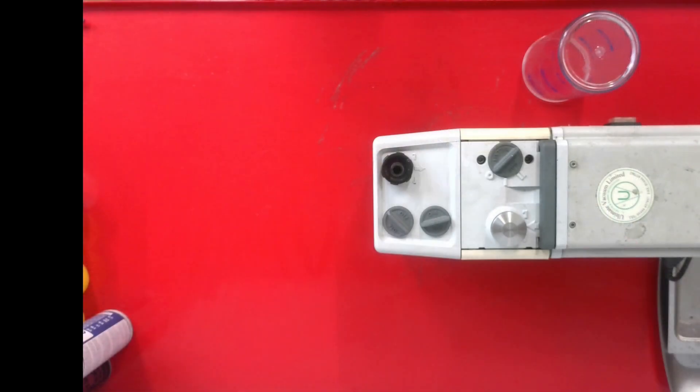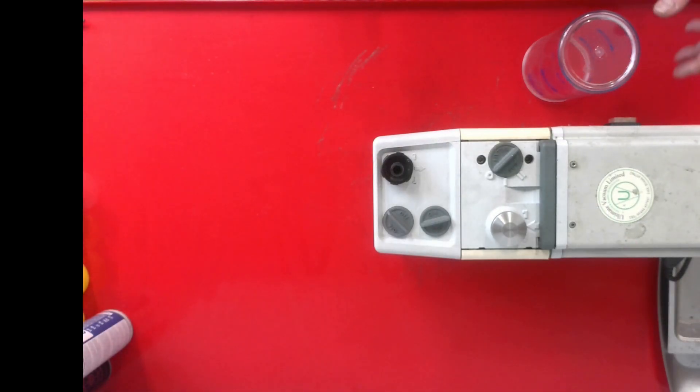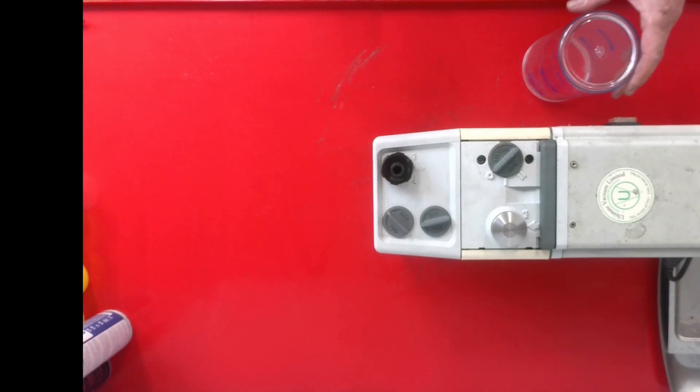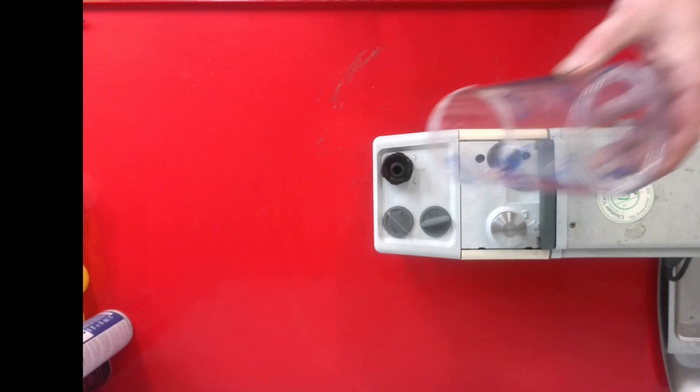In this demonstration, I'm going to put a clear flask over the exhaust of the pump. That's not creating the mist — that's just to make it easier to see. It helps the camera pick it up so that it's visible.